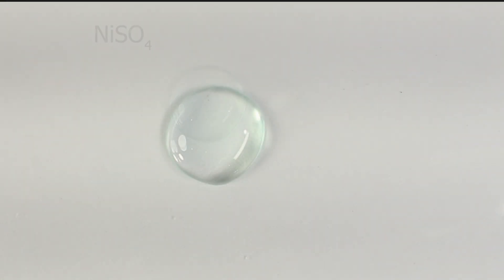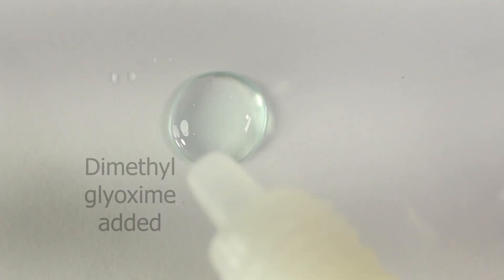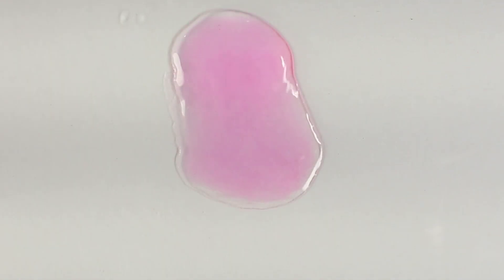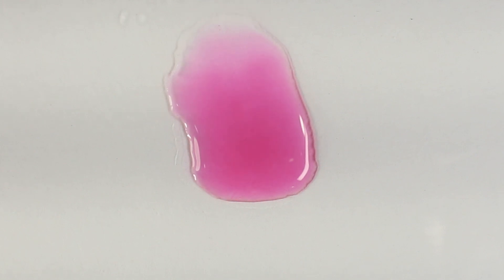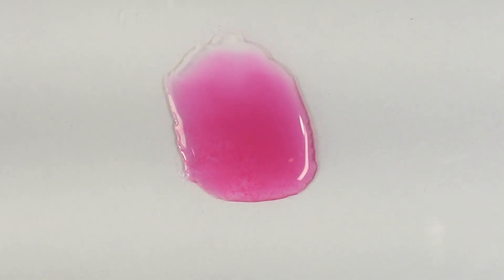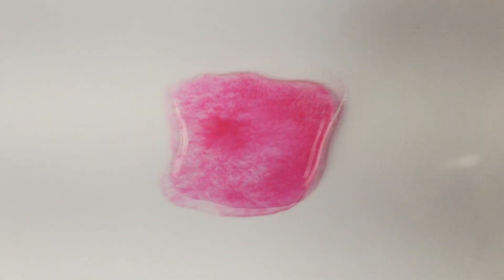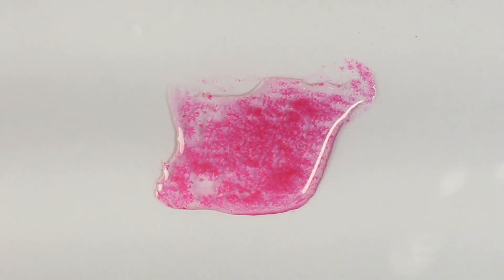Let's run it on microscale. Dimethylglyoxime solution in propan-2-ol is added, and the characteristic red precipitate forms. You can see the crystals of the red complex.